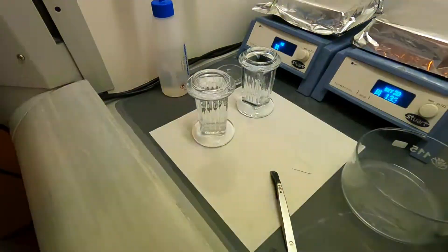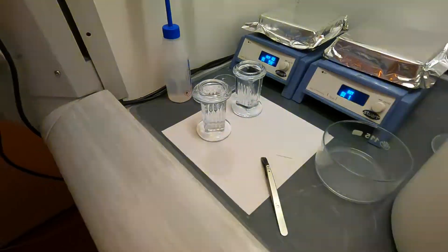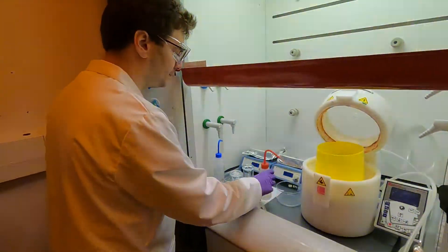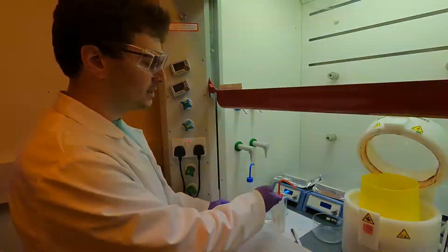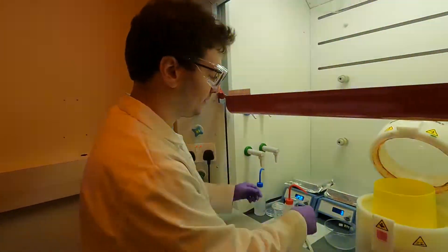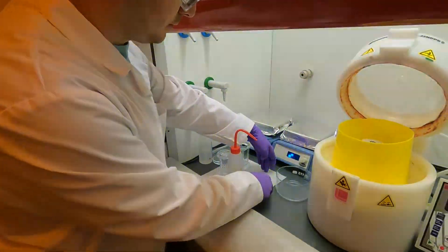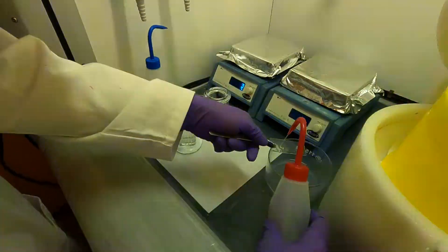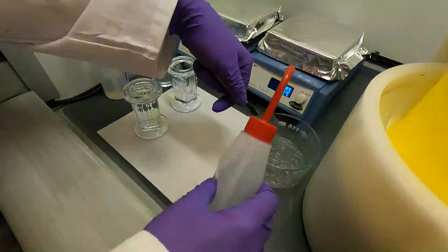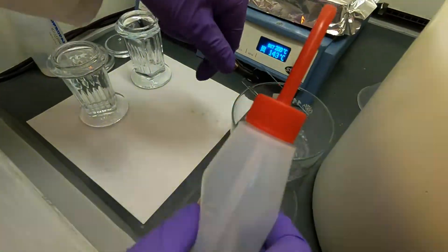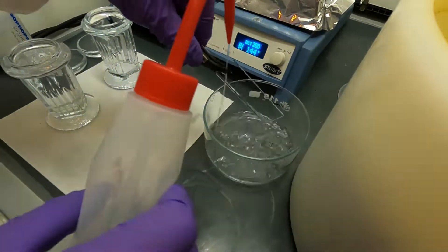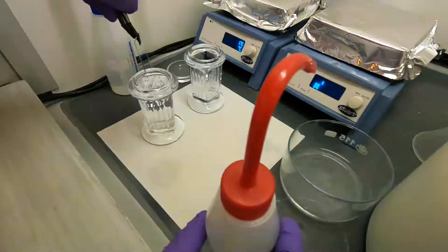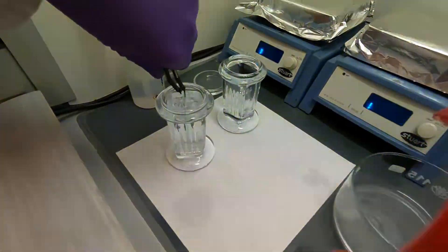The cleaning step is really very simple - this is to get rid of some basic organic contaminants and dust generally from the surface of the sample. We'll be rinsing it with acetone and isopropanol afterwards. I'm going to pick up the glass slide and give it a quick rinse with an acetone wash bottle, both sides thoroughly and generously, and then slide it into one of the grooves of the staining jar.